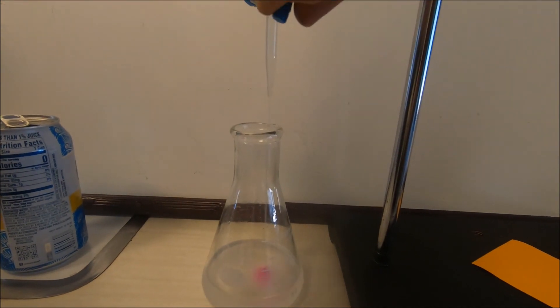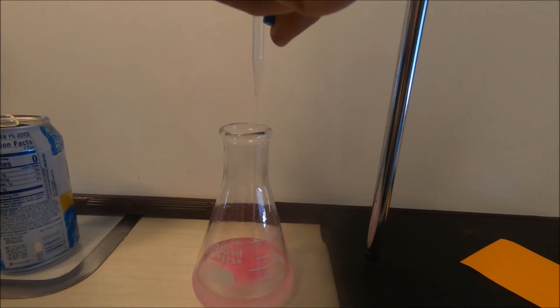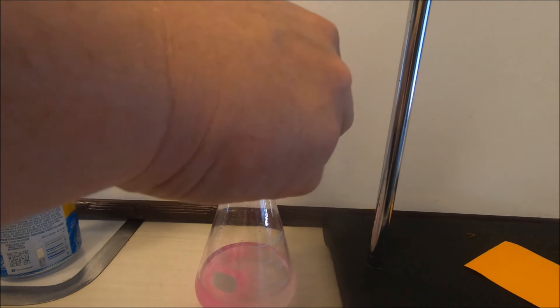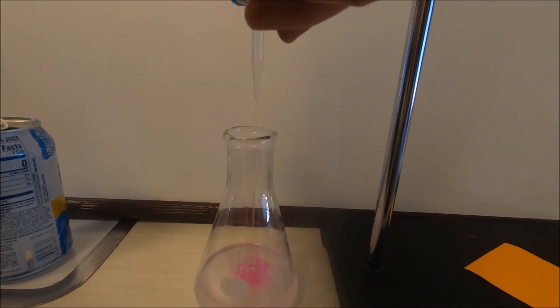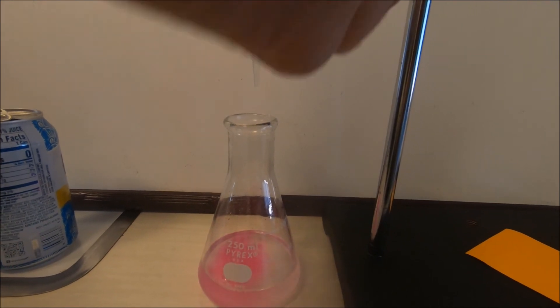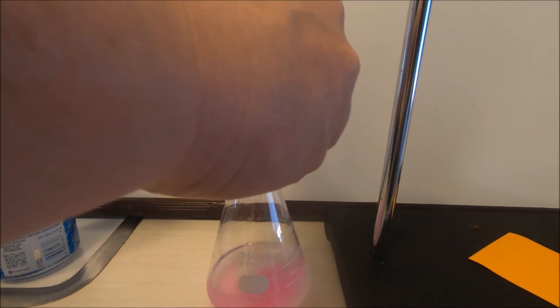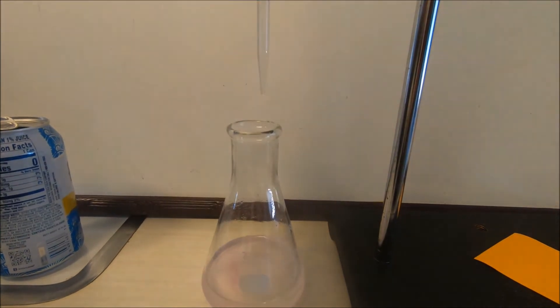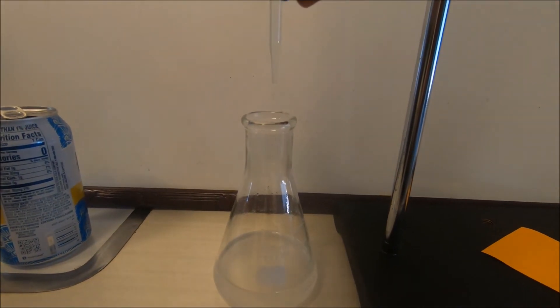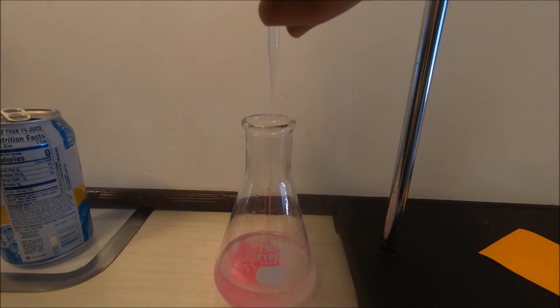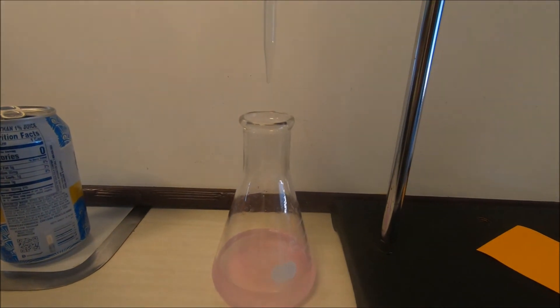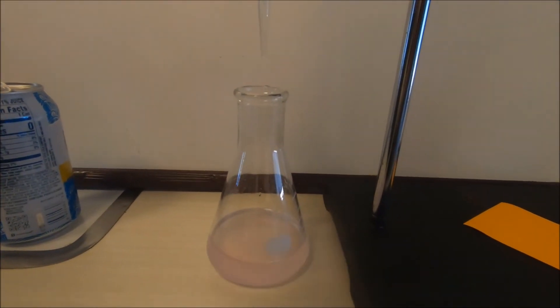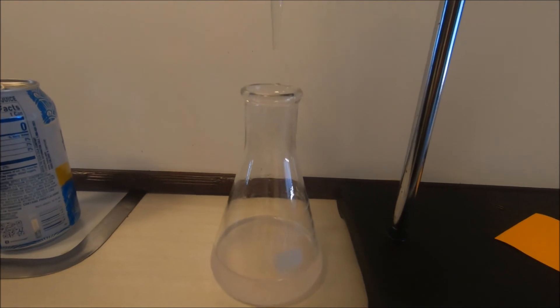We're getting closer to that equivalence point. That pink is staying around a little bit longer before leaving. We want to get it so it takes quite a while for it to fade away. We're almost to that equivalence point, we're going to add just a little bit more.